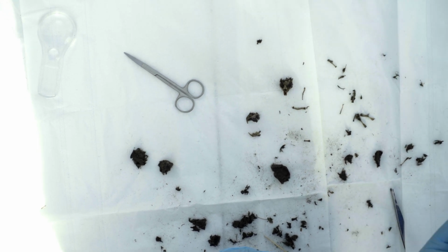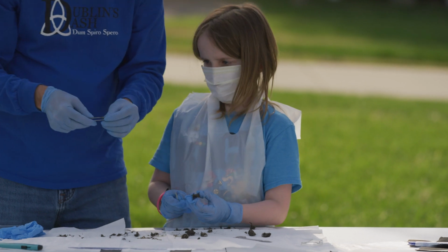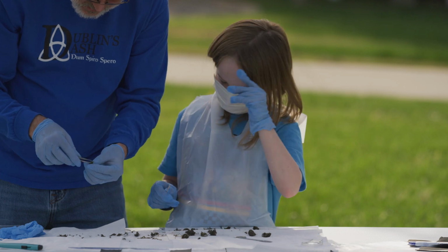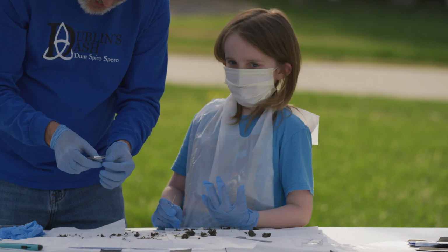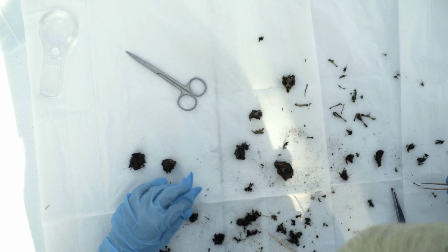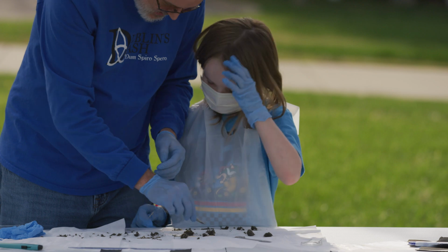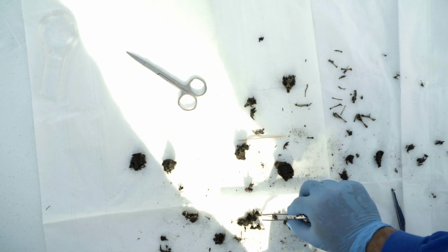There's a tooth bone. Piece of a little small tooth. Oh, there's a big bone here. Got it. Oh, yeah. Look at that. What type of bone is it? Well, these critters had at least 4 legs, didn't they? That's another one. It's a good one. That's a big piece right there. Big bone. Here's a rib. I found a big bone right here. That's the toothpick bone. That's the bone of a toothpick monster. Leg bone. Leg bone. Rib.